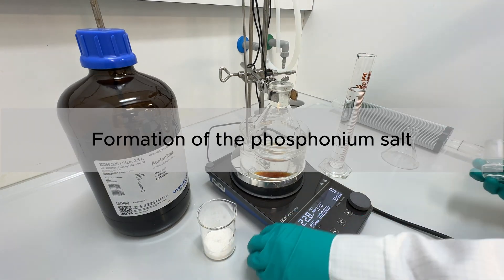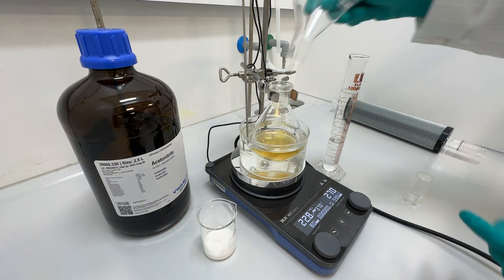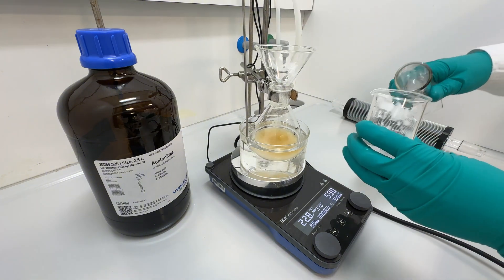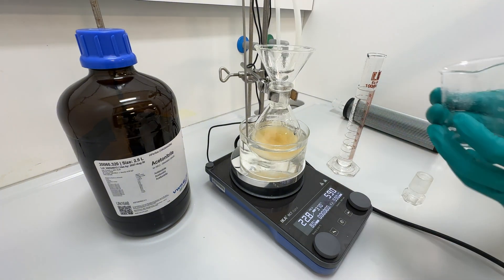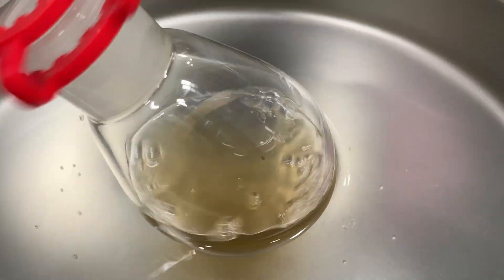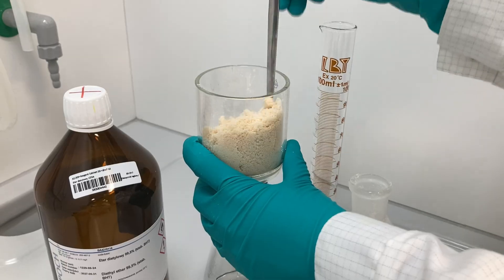To set up the reaction, I had the help of my assistant. Our first step was to prepare the triphenylphosphonium salt. To this end, to a solution of the alkyl halide in acetonitrile, we added triphenylphosphine, and the reaction mixture was stirred overnight at reflux, using a Findenser instead of the traditional Dimroth condenser to save water. After completion, we evaporated the solvent using a rotary evaporator, and the resulting crude residue was triturated with diethyl ether to afford the crude product as a beige solid.